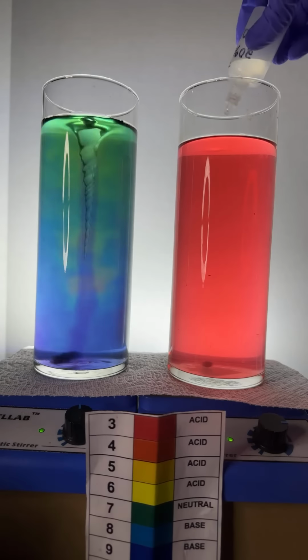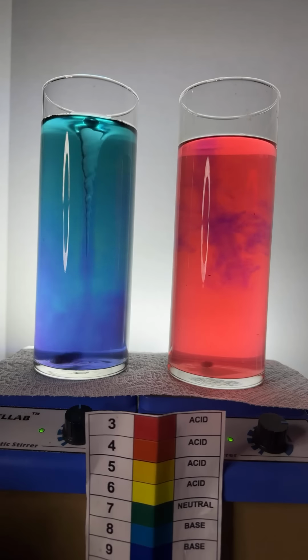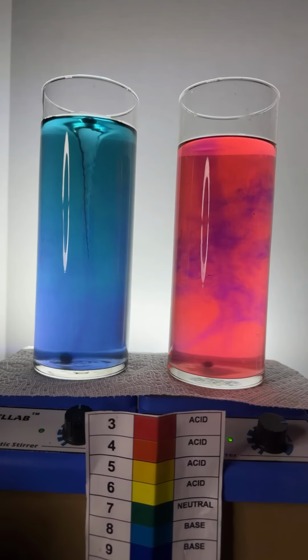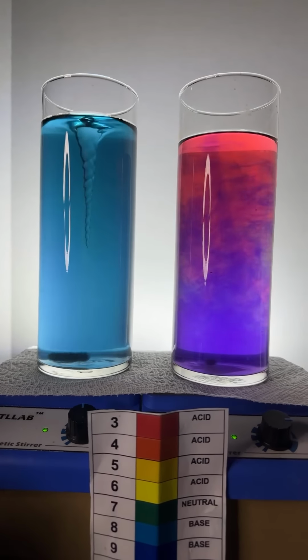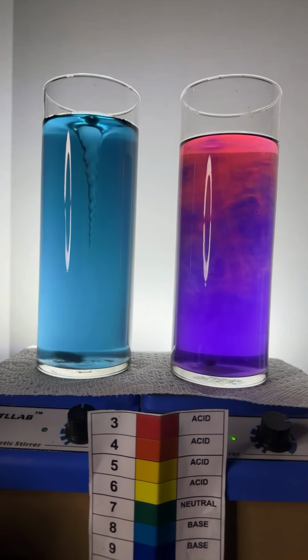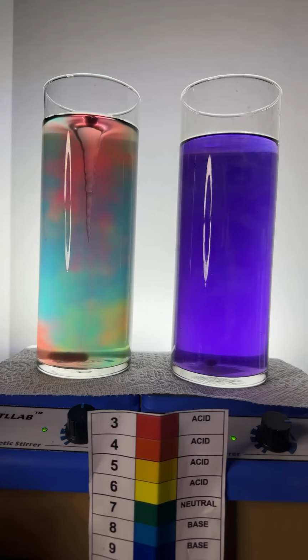Here we go. Add some drops of base over here on the right. You guys want to do the color separation experiment? What do you think? Thank you there, Nunya. I think we should do the color separation experiment. Hey, administrator, doing well. Administrator says they want to see the color separation, so let's go for it. Let me show you how we do this color separation experiment.